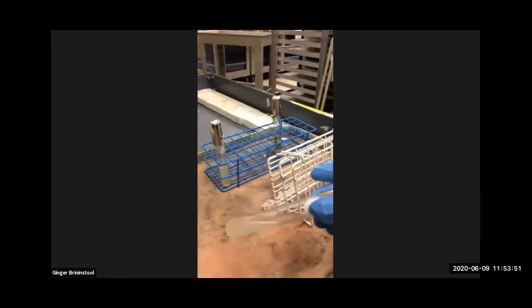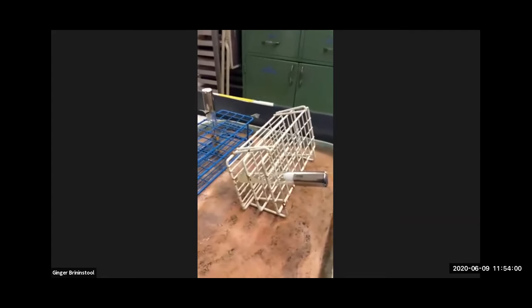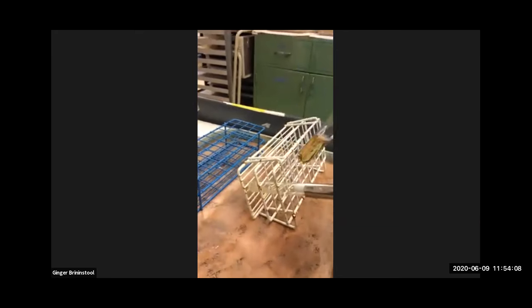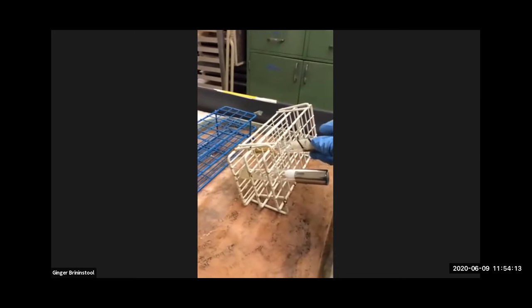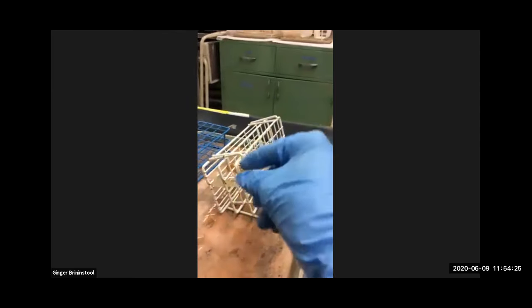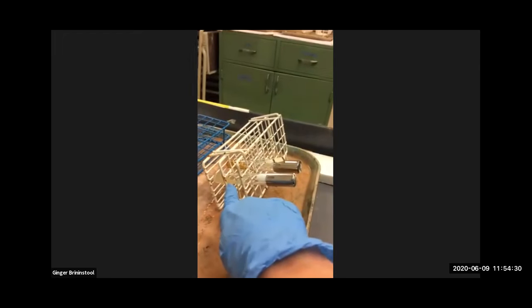This is a slant. How cool is that? So notice that it looks like somebody carelessly knocked this rack over. They did not. In fact, they took nutrient agar that had been sterilized and they put it in at an angle. And in fact, you can sterilize it at an angle. You don't have to, you can sterilize them upright. And then when you take them out of the autoclave, you lean the racks down. And when they cool, it solidifies into a slant.